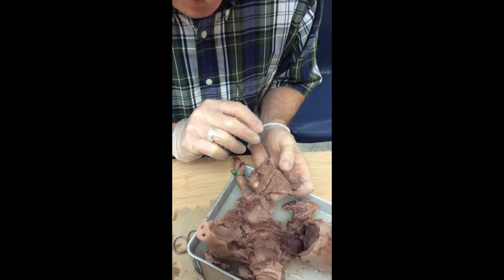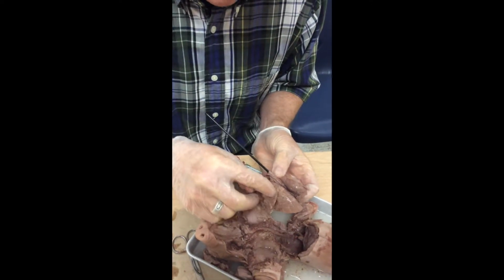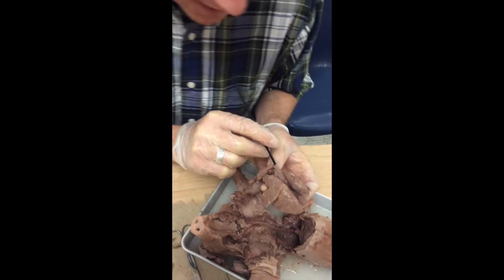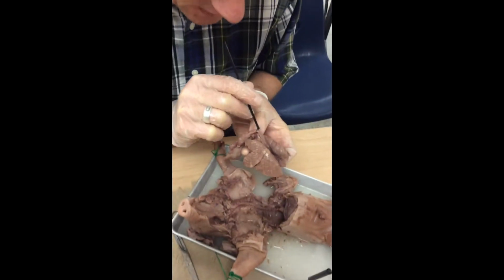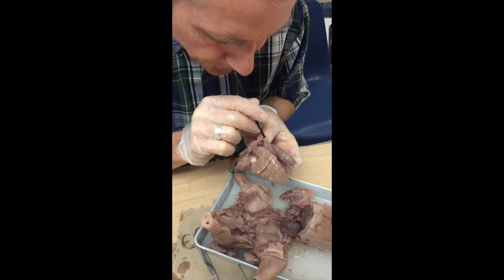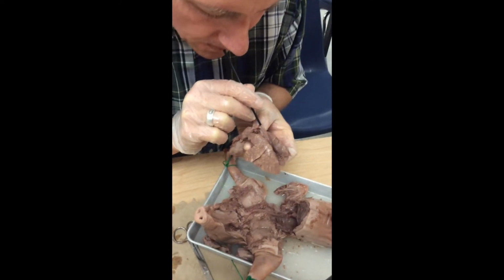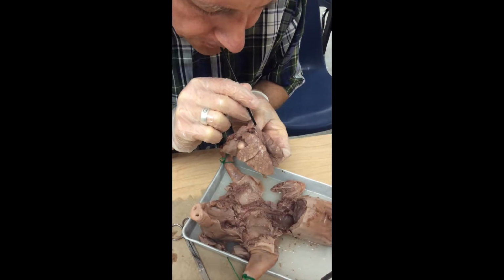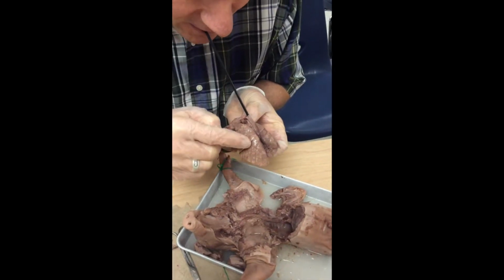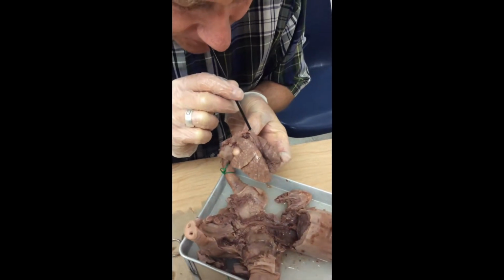I may have too many leaks in our lung, but you do see that it's starting to inflate in certain areas. The color is changing a little bit as the fluids are evacuating and it's being restored to its normal, flexible origin. We're seeing it a little bit right in here, a little bit of inflate and deflate.